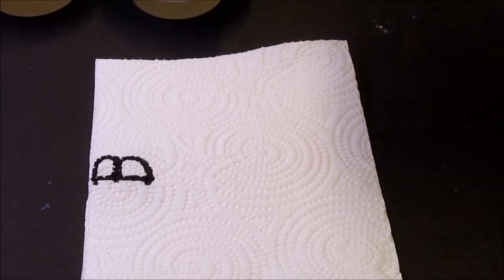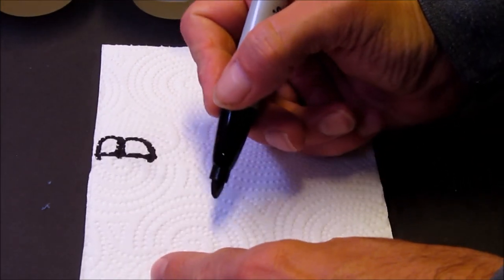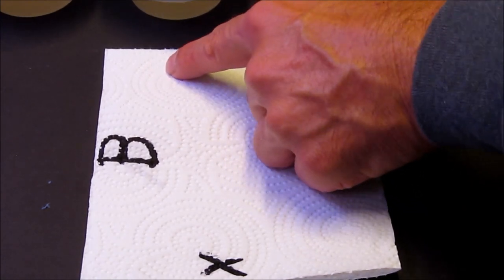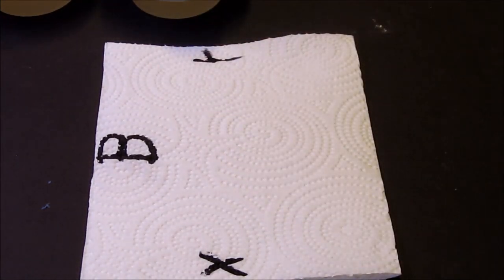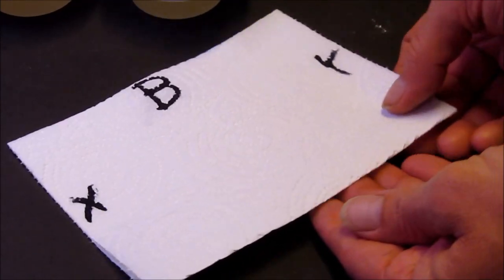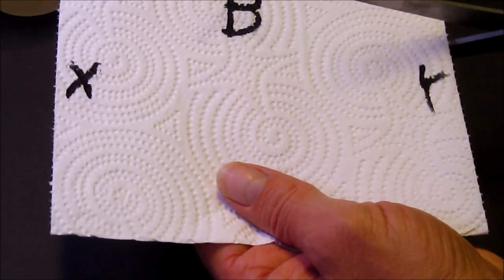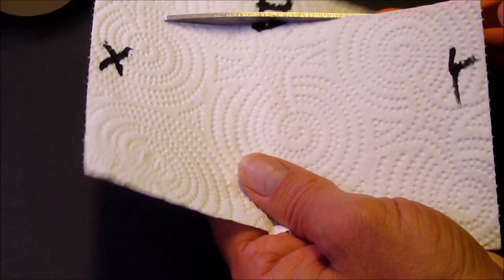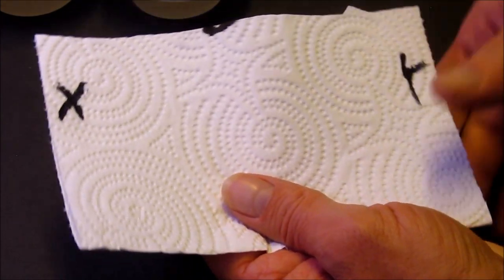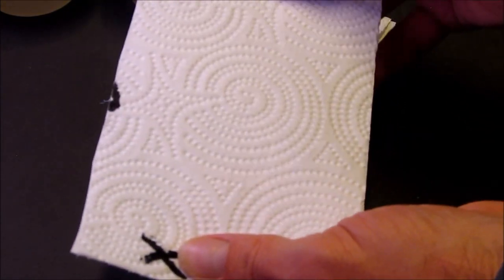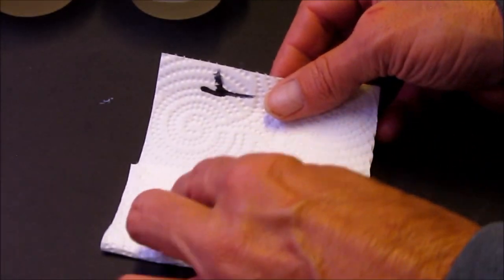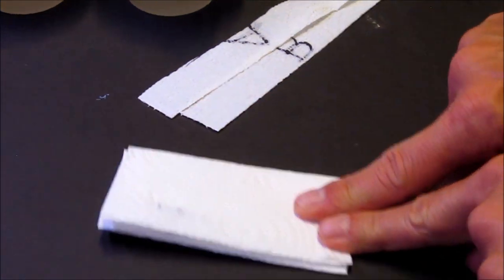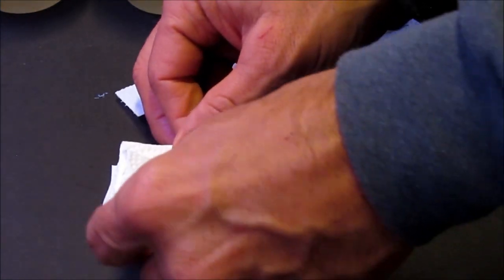Flipping it over one more time, you can get this A at the top, so then B, fold it over on top of A. If it helps, we'll do this also. I have X and Y. I sort of turn that. I'm going to cut off B and A where they were marked, about an inch and a half or so. Doesn't have to be exact, it's not rocket surgery. Going back to X and Y, X goes in, Y goes on top of it. Smooth that down, and then fold that up.